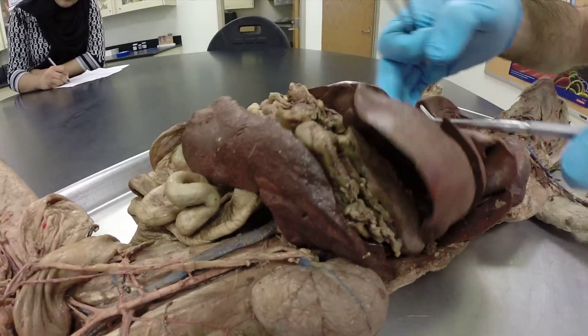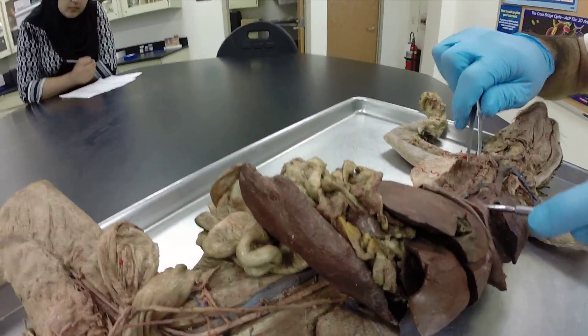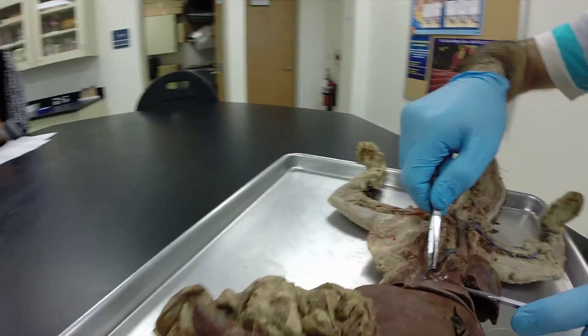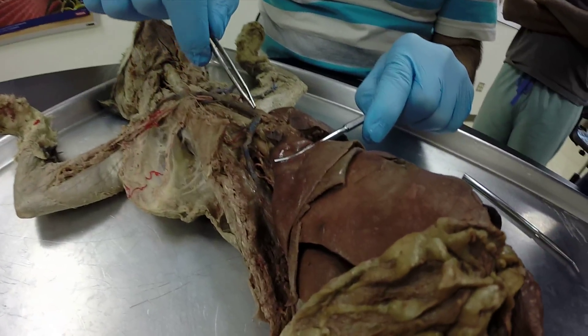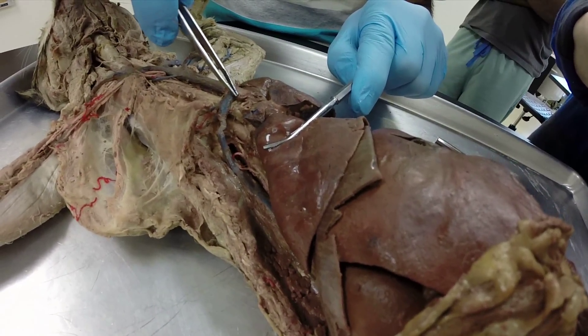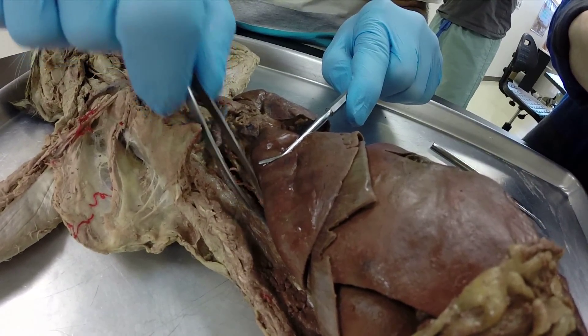Here is the azygous vein, which comes pretty much straight off the pre-cava and then turns and heads downward.